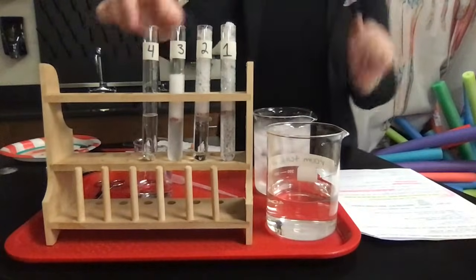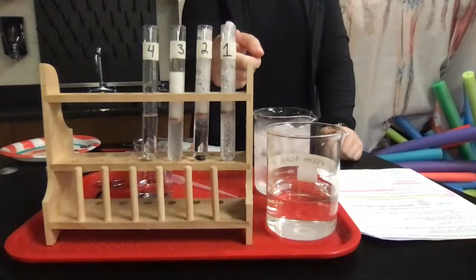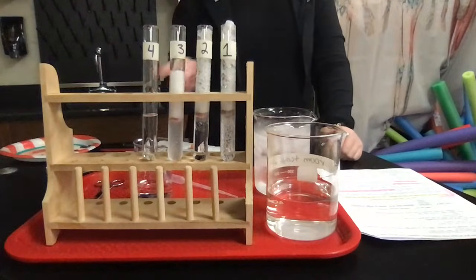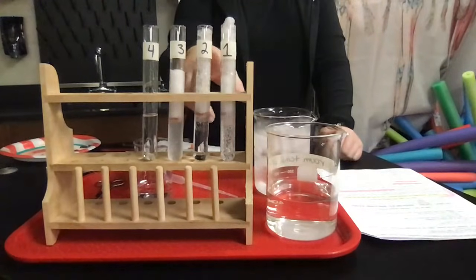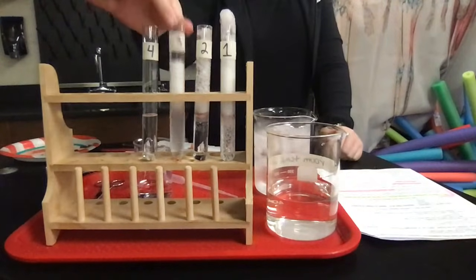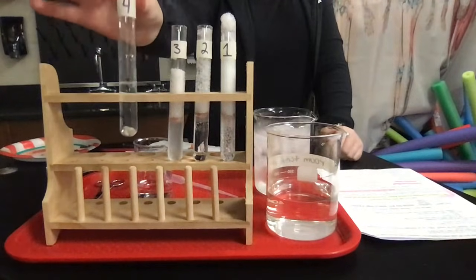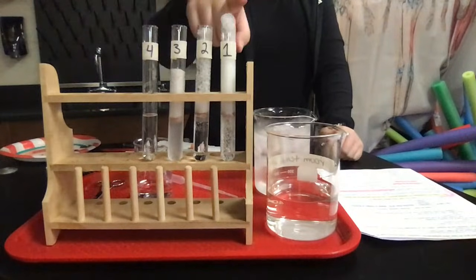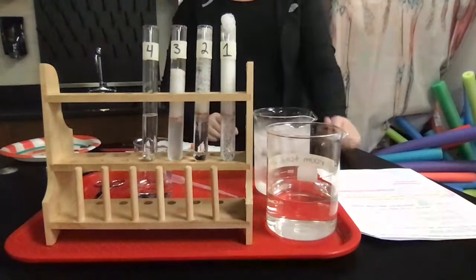I would still say that 1 had the best reaction, which is exactly what we would expect. Because like I said, this was at physiological temperature, which is the temperature of your body roughly. And that's where this liver should be functioning the best. And then the second one was room temperature, which was 20 something degrees Celsius. See, this one's still going. Look at him go. And then number 3 was in the cold environment, which still has a pretty good reaction, but we'll talk about that in just a second. And then our last one, you see just a couple of bubbles forming, but really I would rate this at a reaction rate of 0. So I would probably rate these at like a 5, a 4, maybe a 3 or a 2, and then a 0. Okay, so that's how temperature is going to affect this enzyme.